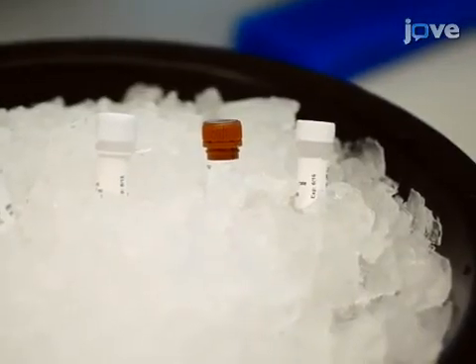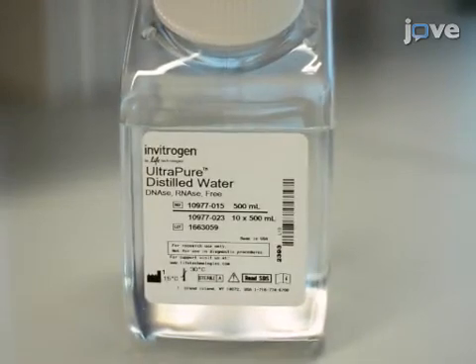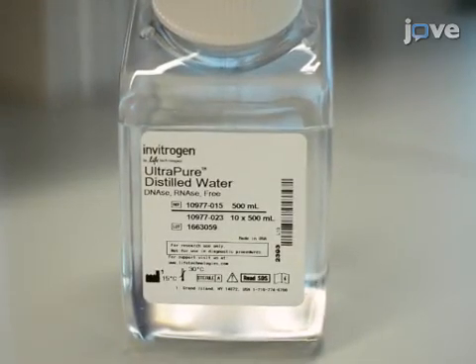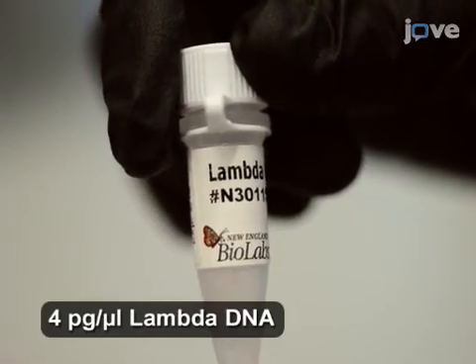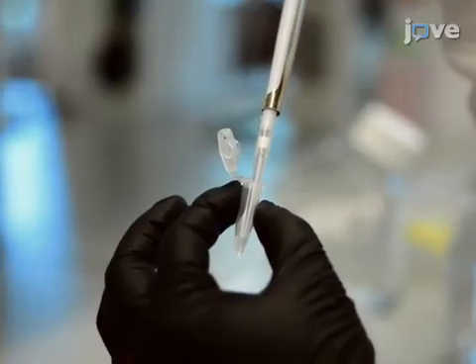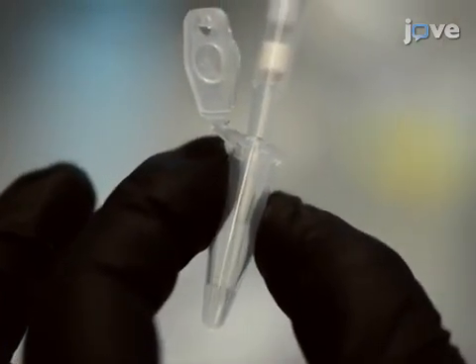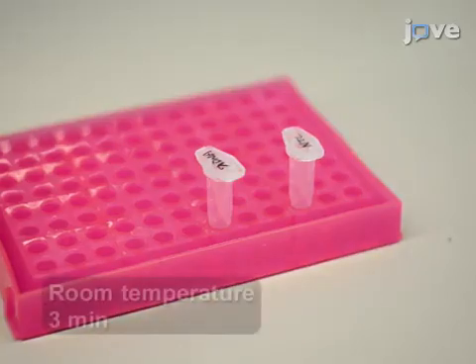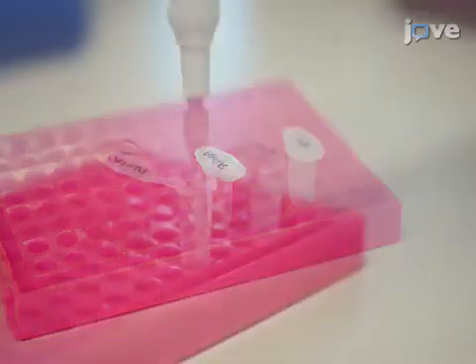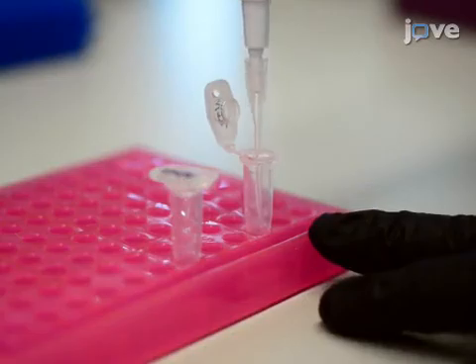Prior to starting this assay, prepare all necessary reagents as described in the protocol text. Two standards are required: one no template control, such as nuclease-free water, and one high template concentration, such as lambda DNA. Denature 3.3 microliters of each standard with 3.3 microliters of denaturation buffer in a qPCR tube. Incubate at room temperature for 3 minutes. Quench each with 3.3 microliters of neutralization buffer.